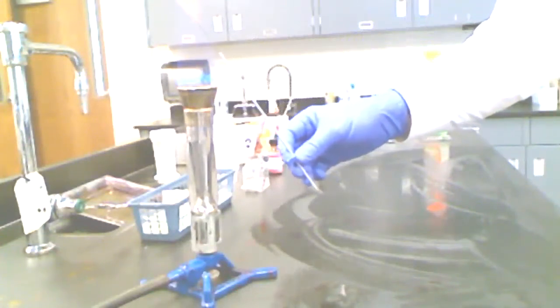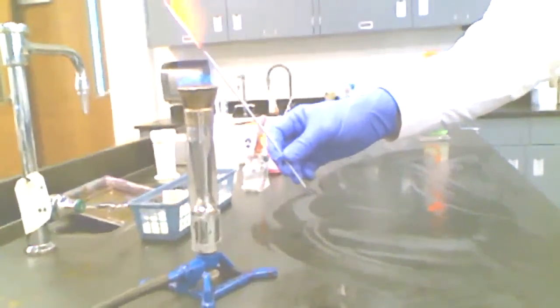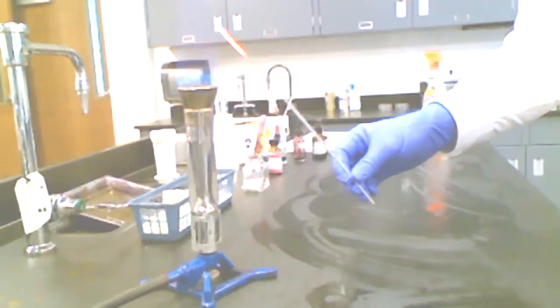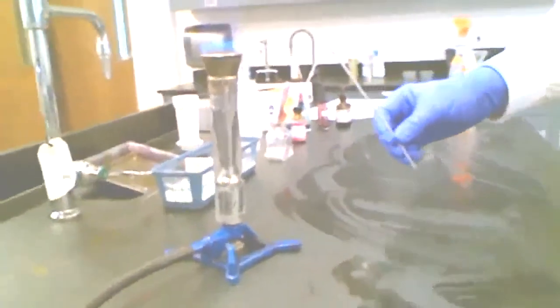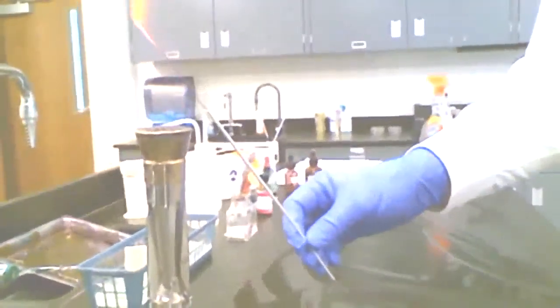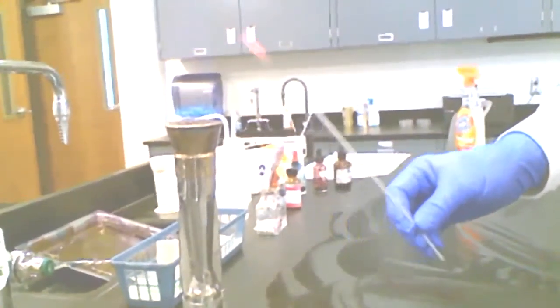Some people will lay the loop, the wire in there perpendicular to the flame. I kind of like to put it in like this so that it's more in line with the long axis of the flame, I guess. And notice how the whole wire is heated to an orange color. Let me see if I can scoot that in a little bit. There you go. That may be a little bit better. I want that entire wire to be heated to orange, all right? Every last bit of it.